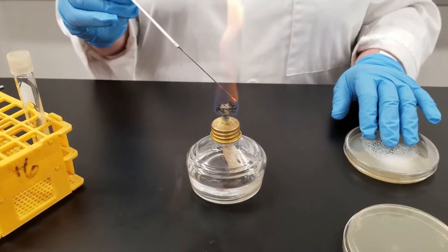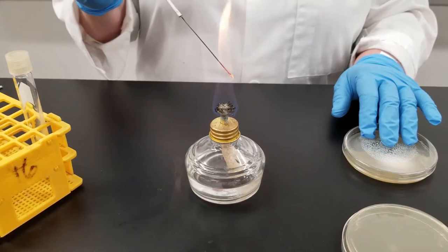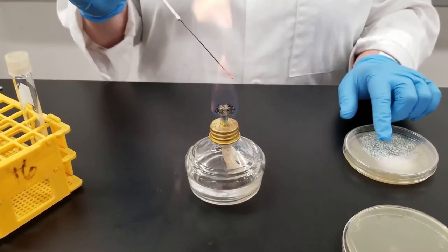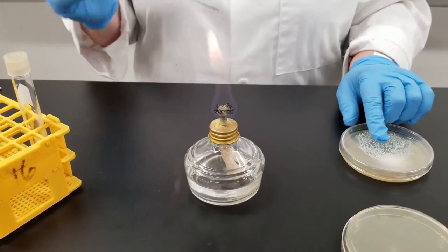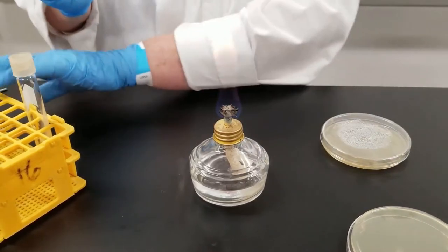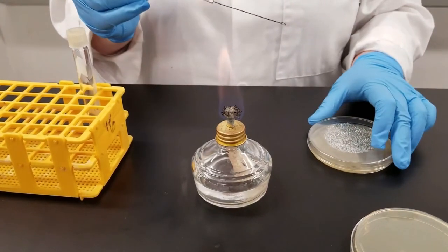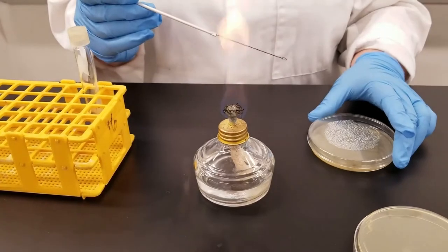You'll notice I flipped that petri dish upside down. We always incubate petri dishes upside down in an inverted position. The reason for that is because you can see on this plate that has been stored, we store it in the fridge after 24 hours, you get condensation on it. When you are trying to grow cultures, that condensation will mess up trying to get individual colonies. So we always invert them.